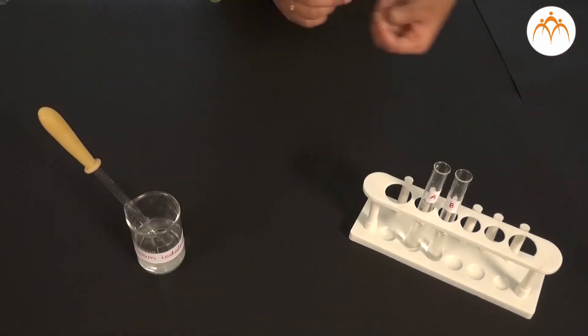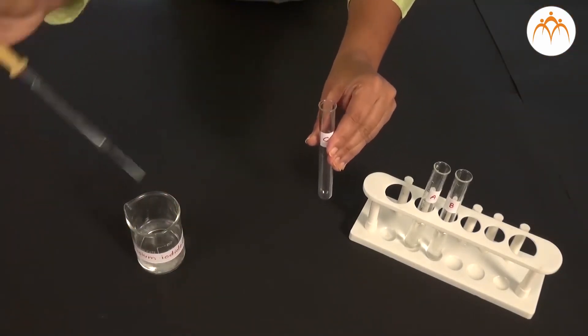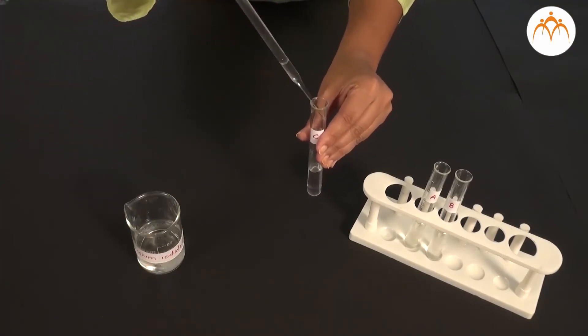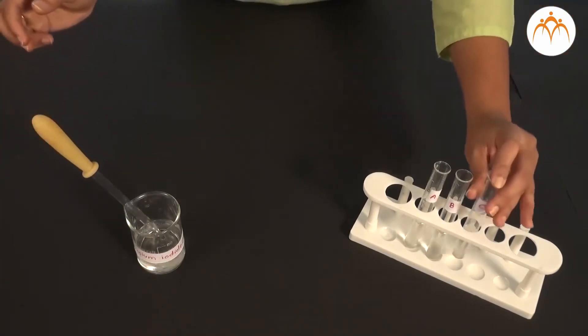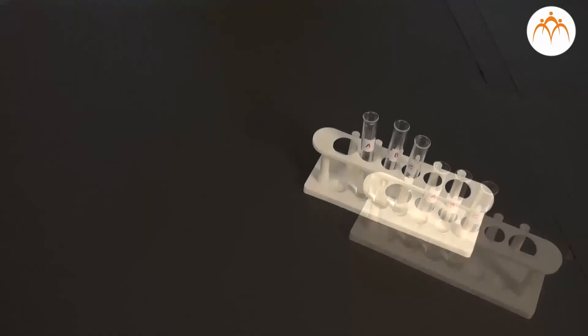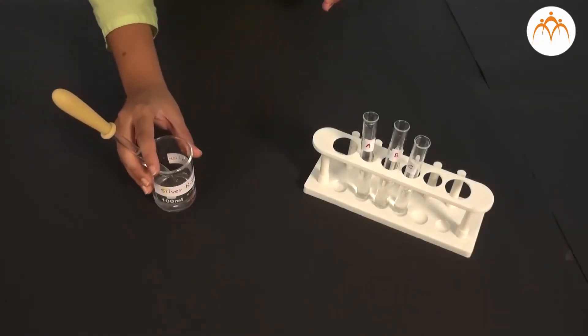Then you will observe what happens. We need to be careful while adding silver nitrate. Don't waste silver nitrate. It is a costly reagent. Adding a very few drops is enough for the chemical reaction.